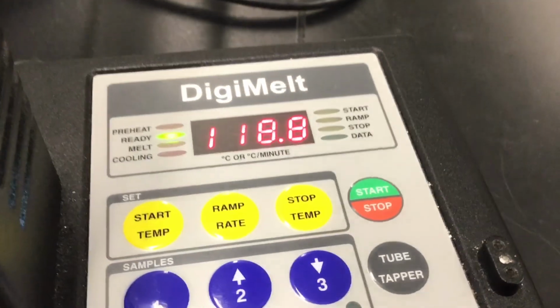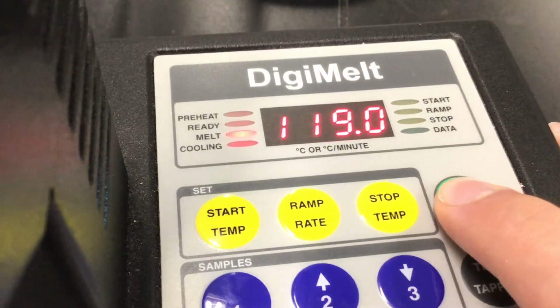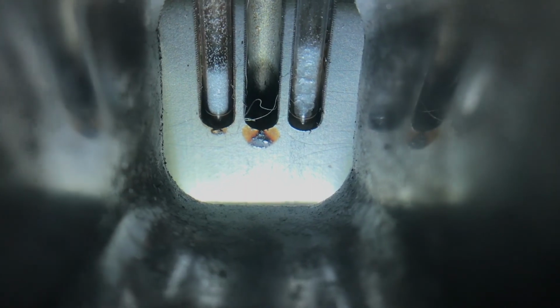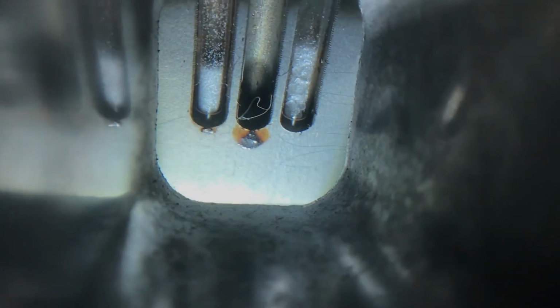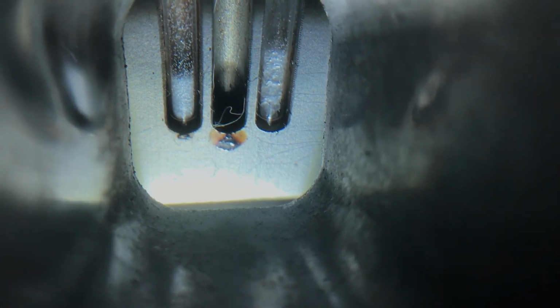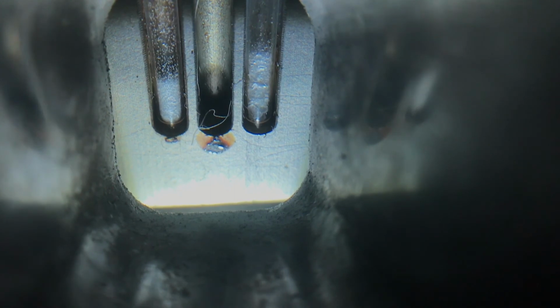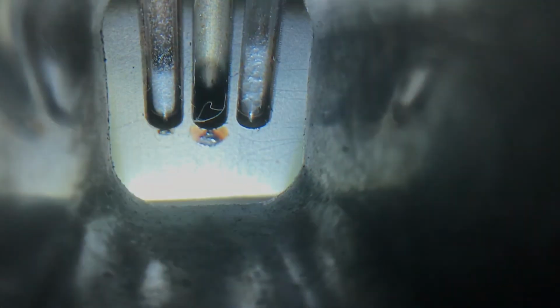So it's just about at 120, so it's going to let me click start again. It says melt. And now it's going to go at that ramp rate we set at 5. You can do it at 2, 5, 10, and 20. The slower it goes, the more accurate your reading can be. So again, on the left is our sample from the aspirin tablet, and on the right is the sample from TCI that we got out of the bottle.